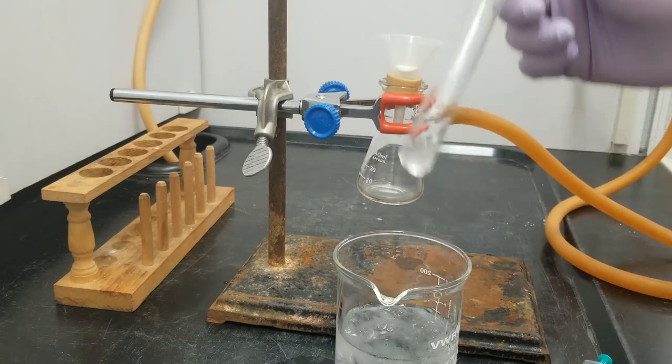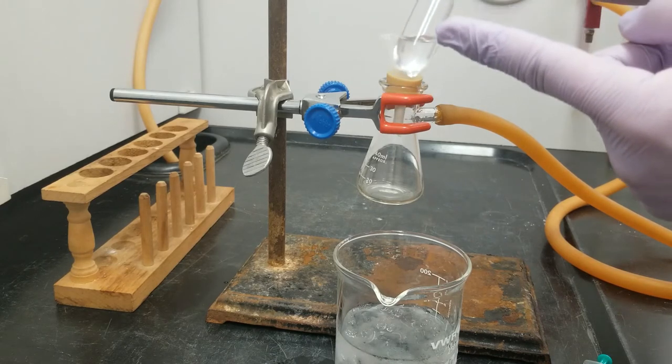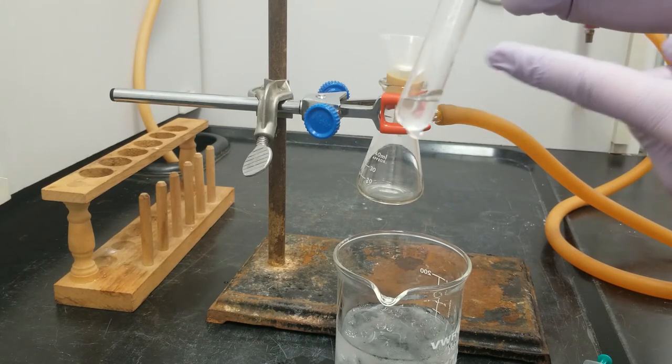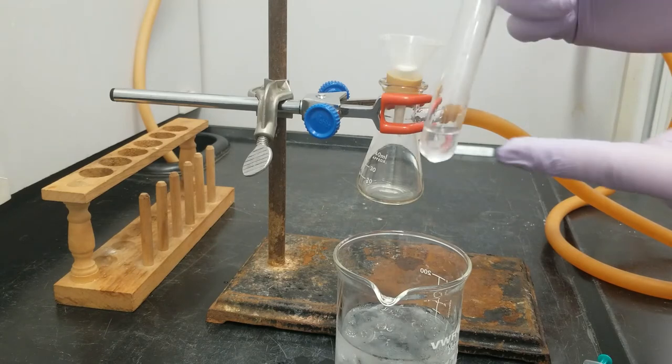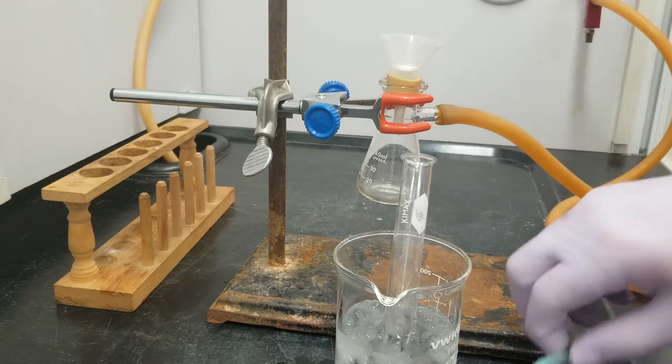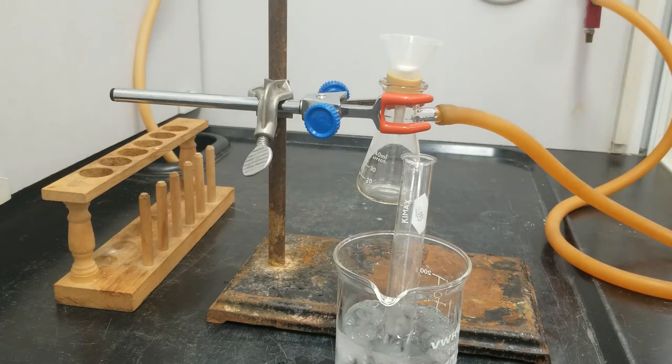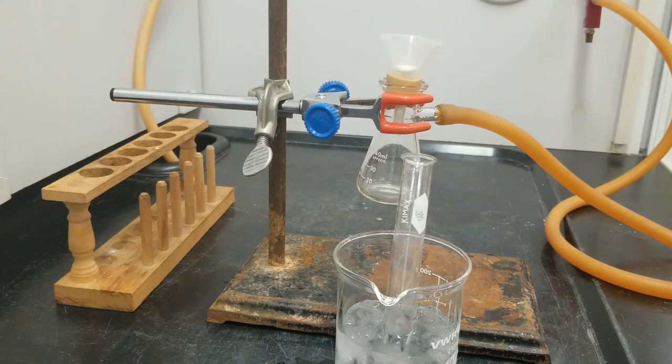One thing when you are collecting by vacuum filtration, make sure you can see the solids in your solution before transferring it to your filter apparatus. If it's all liquid, it's just going to get sucked right through, and you're going to lose your product completely.